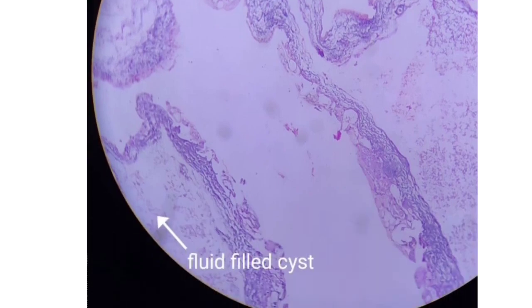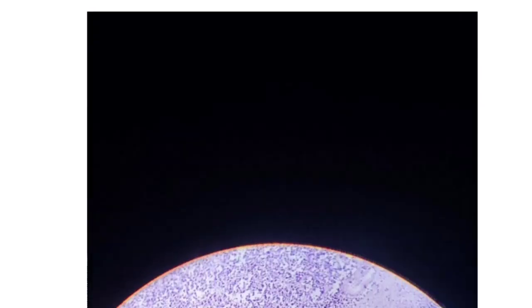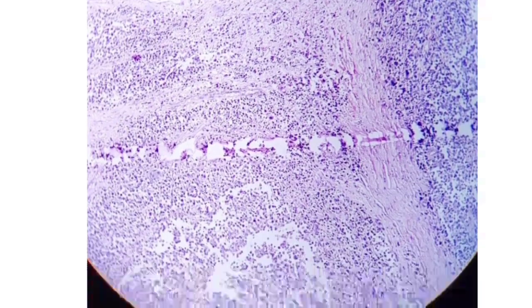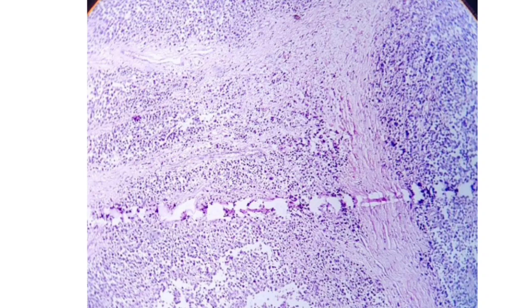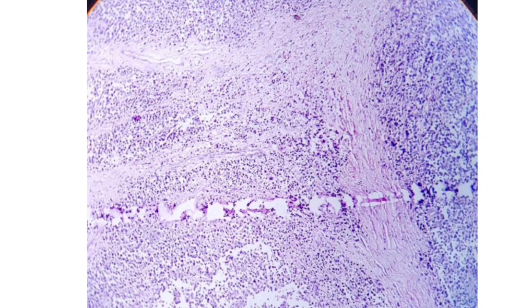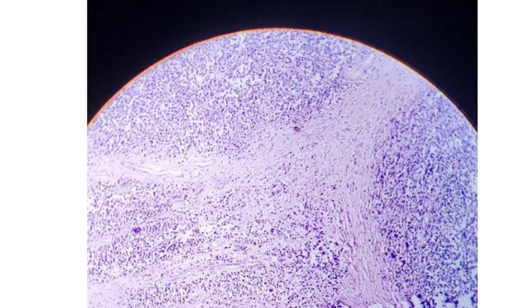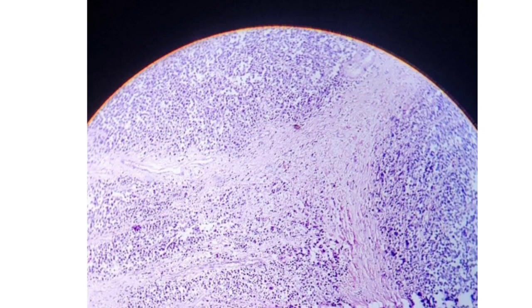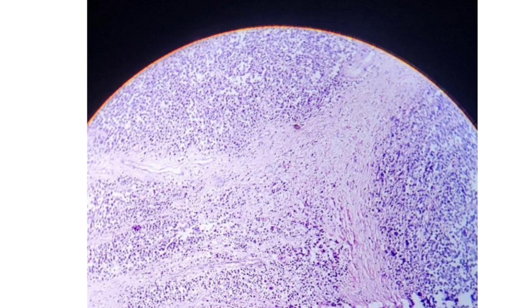Next is seminoma. Seminoma is a malignant tumor of the testis in the male genital system. Here you can see the seminoma cells arranged in lobules.